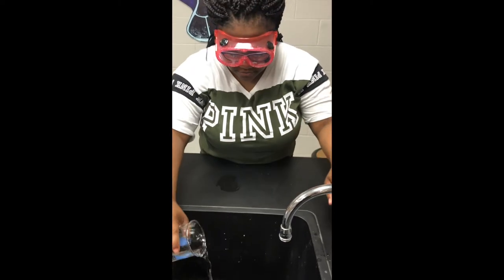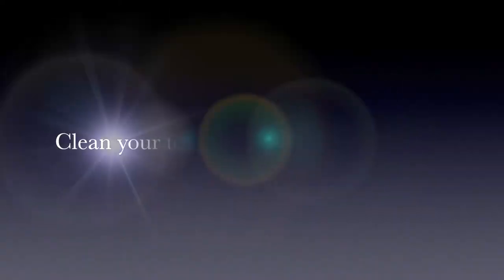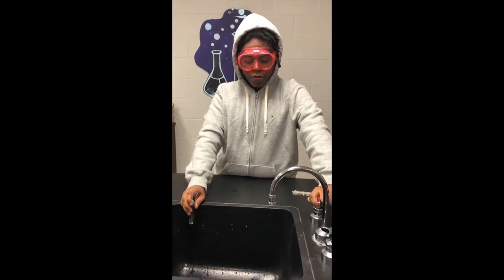If a chemical is safe, put it down the sink and run hot water behind you. Wash out your test tube and clean it with a test tube brush.